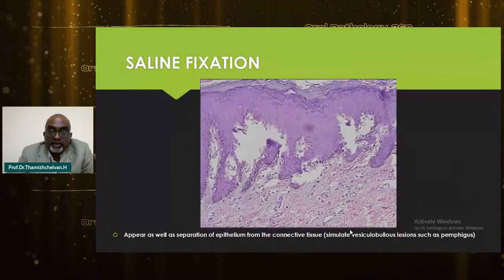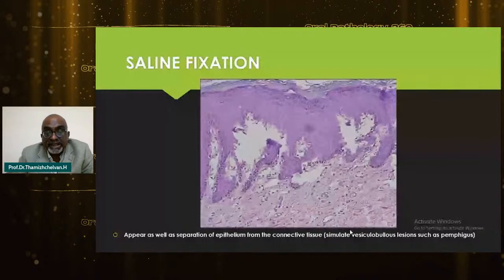This is a very common problem, but it's reduced to some extent nowadays, because they might put the specimen in an LA bottle with saline or in plain LA, saying that it is somewhat equal to a fixative. But this is what happens when they give it in saline or in LA: a complete separation of the epithelium from the connective tissue, resembling pemphigus. So the biopsy report will completely change because of these prefixation problems.